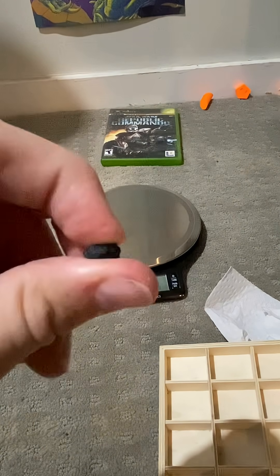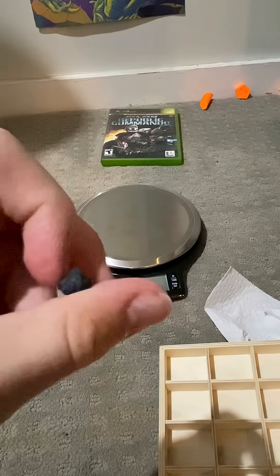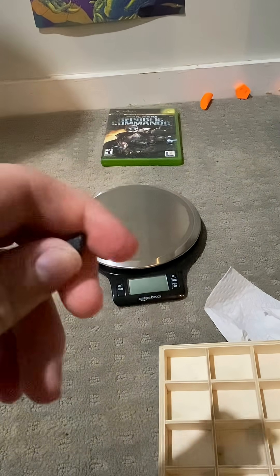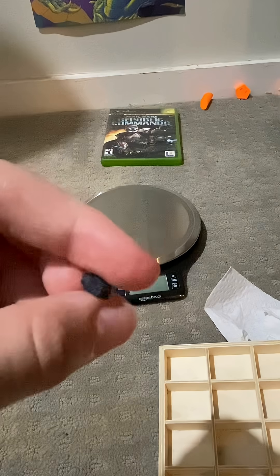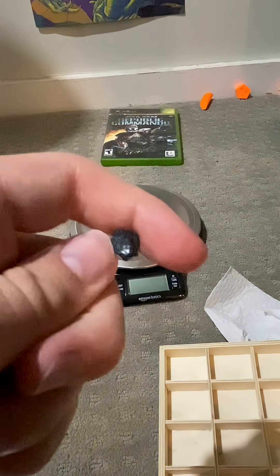The hardness of lanthanum resembles zinc, which is why it's pretty easy to cut. Not that easy, but you'll eventually get used to it if you use something other than a knife.